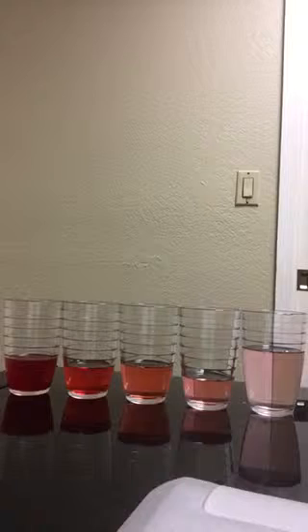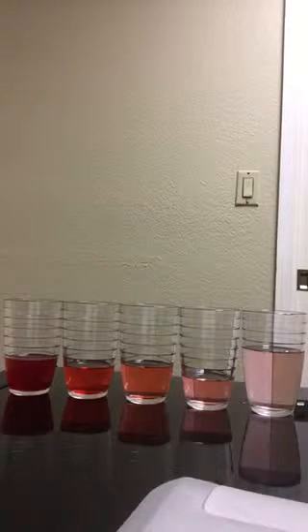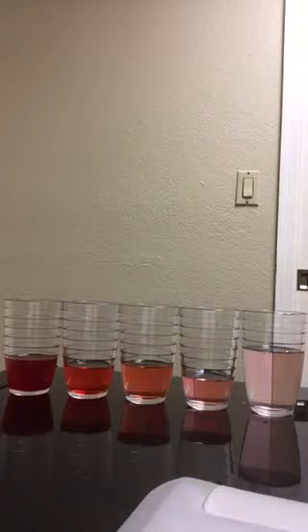Next, I found the number of moles of the solid by using the unit factor analysis method. So I took the mass of the solid, 4.5 grams, and multiplied that by 1 mole over the molar mass, which is 342.34 grams per mole. This gave me a total of 0.013 moles. Then I added 150 milliliters of water to the Kool-Aid solid to give me a solution of the liquid water and the Kool-Aid solid.